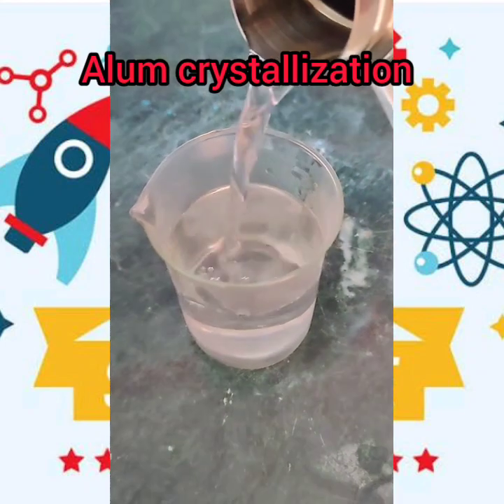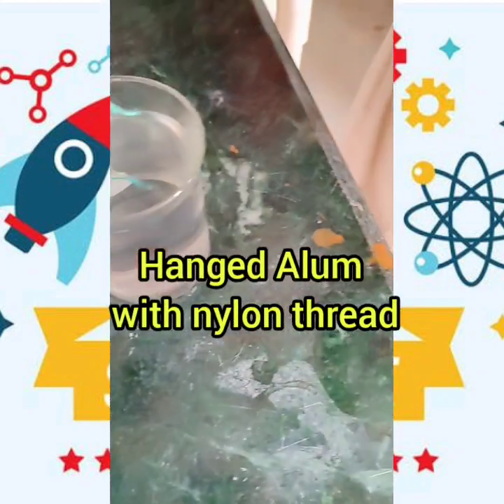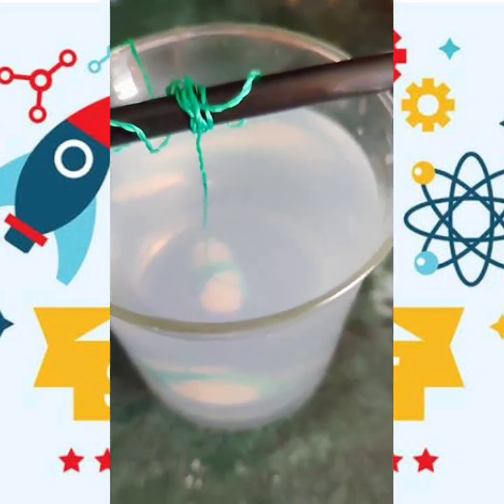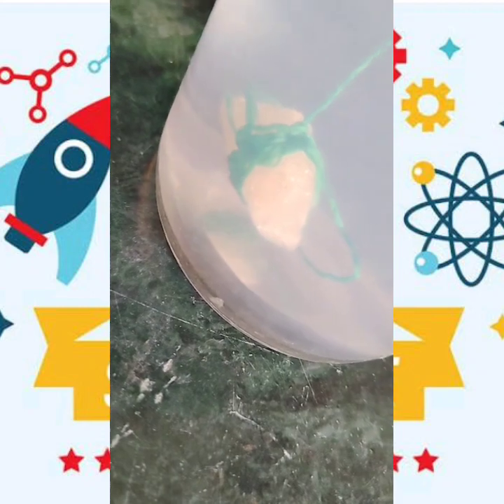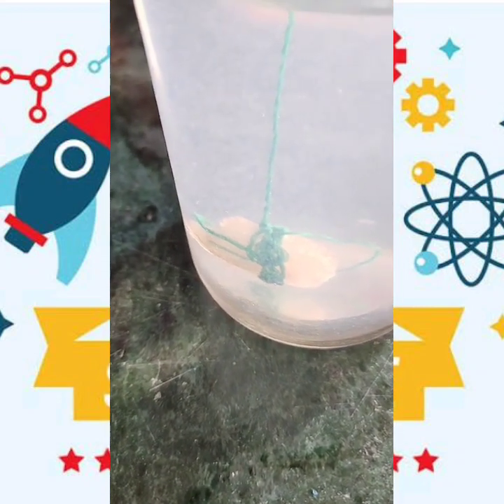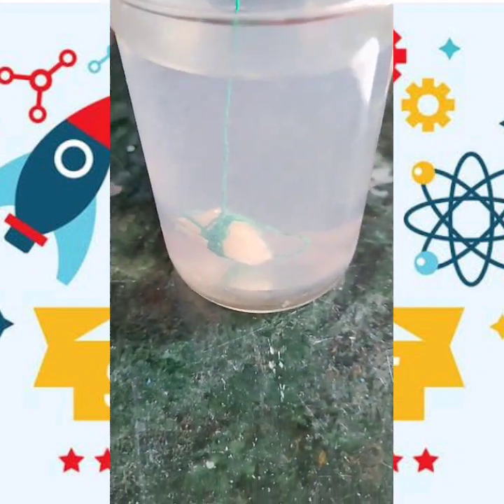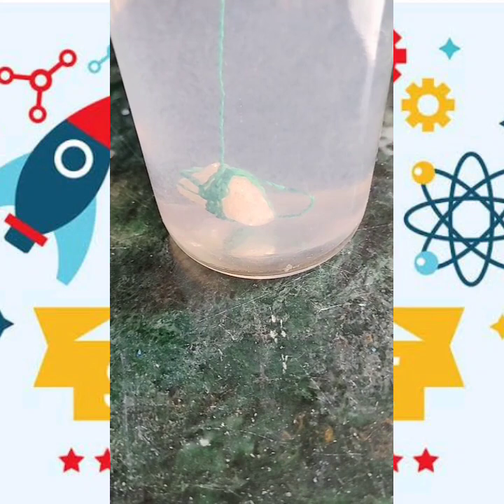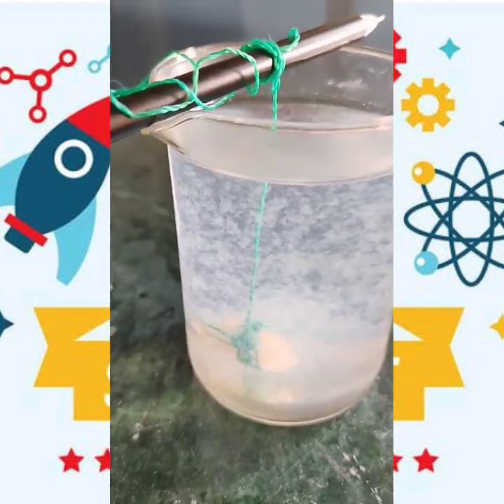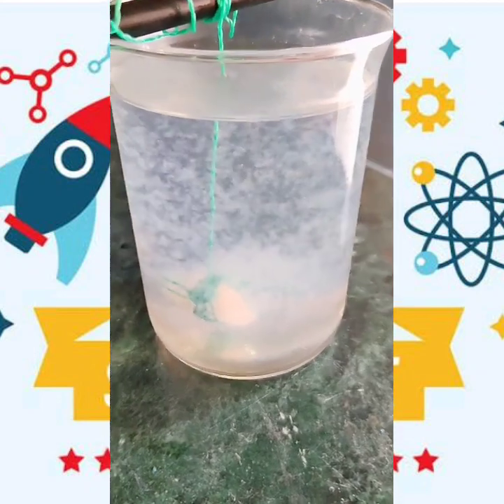It is an experiment of alum crystallization. First of all, we have taken hot water and hanged an alum attached with a nylon thread. We have put this alum in the boiled water. Now you can all see the changes inside it — slowly it is turning into an alum crystal. You can all observe the changes. Now you can finally see these alum crystals inside the water. These are all the activities about the alum crystallization.